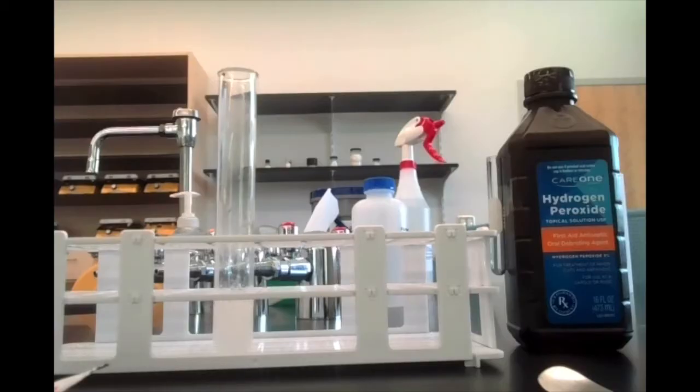What we do with catalysts is we write them over the arrow. So when you're writing out your equation, have H2O2 as a liquid on the reactant side, and water and oxygen gas on the product side, but above the arrow, write yeast to show that yeast catalyzed this reaction. It was present as a catalyst.